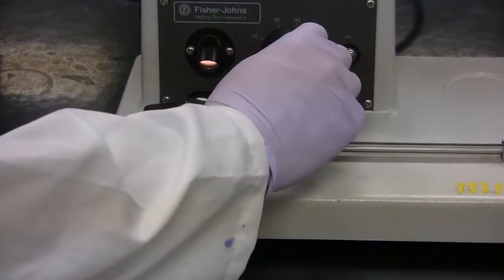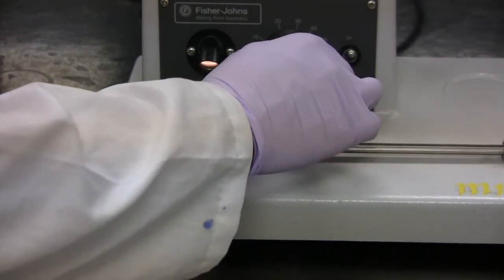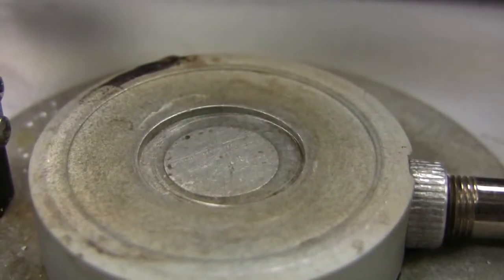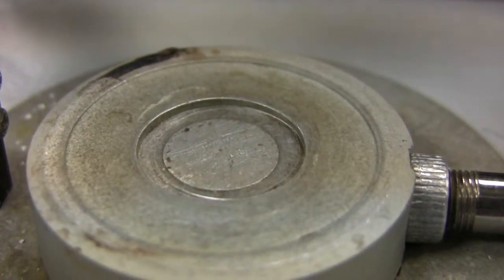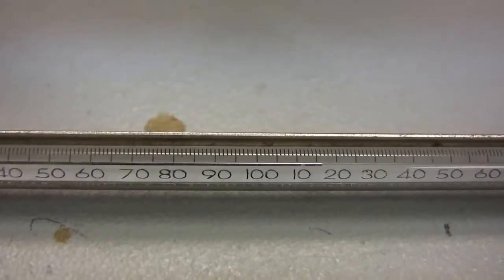Start by turning the intensity up to about 70 or so. Upon first signs of melting, record the lower end of the melting point range, and also turn down the intensity by about 10 or 20.